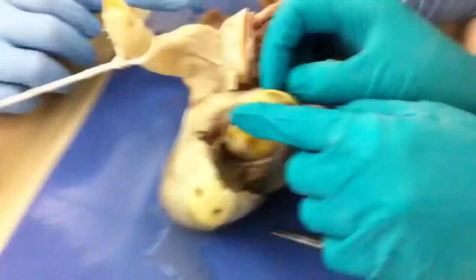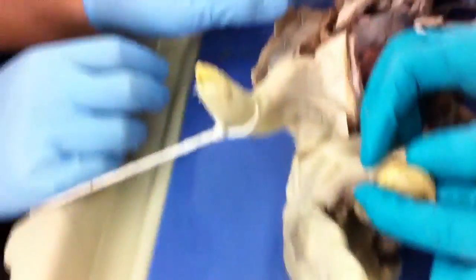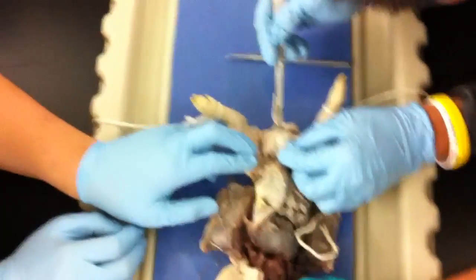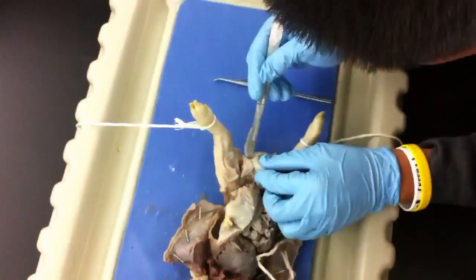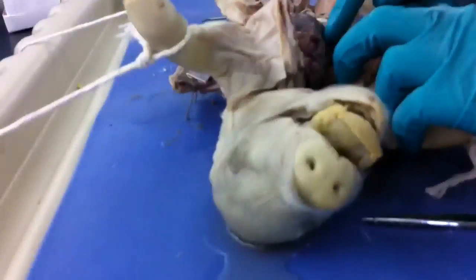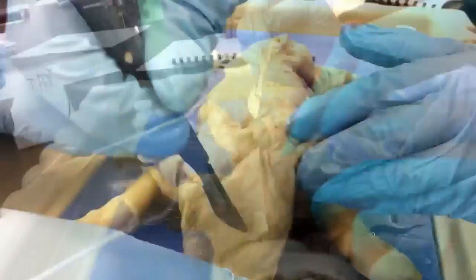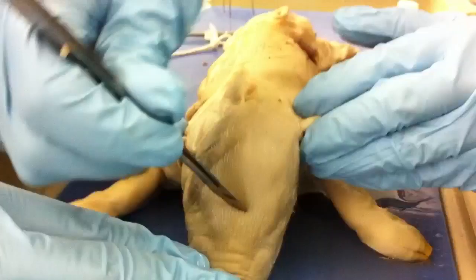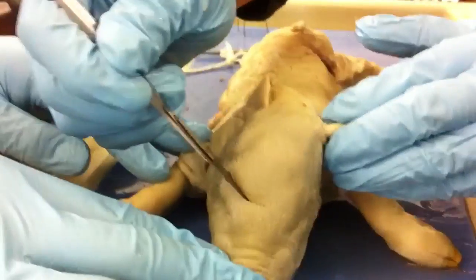Wait, here it is. Look, there's a little bump. So like, are we supposed to be writing stuff down? I don't think so. Yeah, there's a page. Don't wipe that. Where's the rectum? Don't cut it. You're supposed to. Let's get chopping. Stab it.